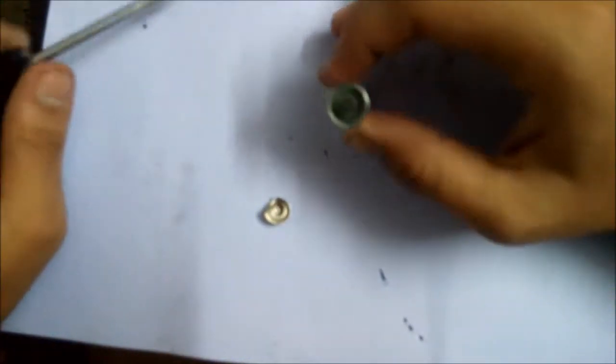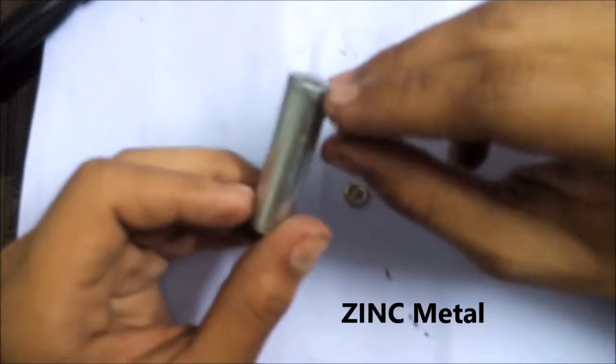Yeah, so here it is. Now if you see here, this metallic casing is the metal zinc, a very important required chemical in the lab.